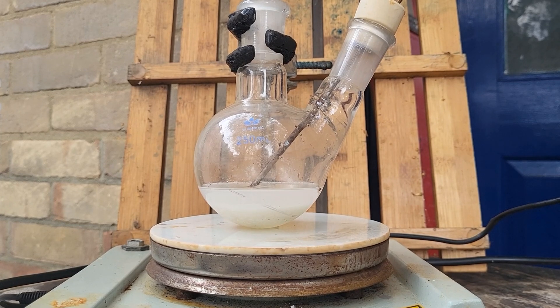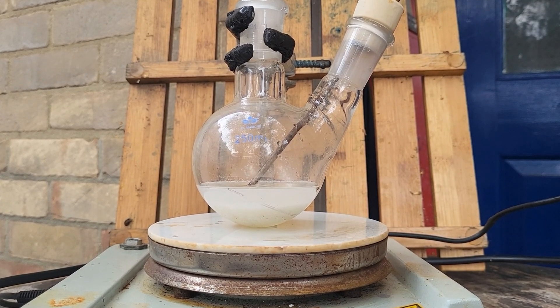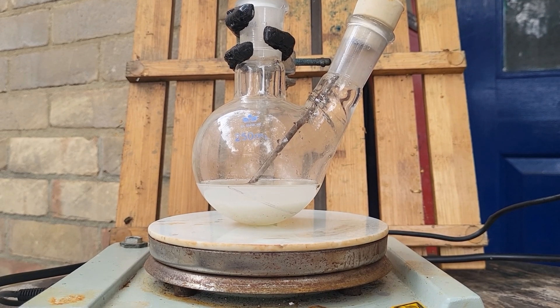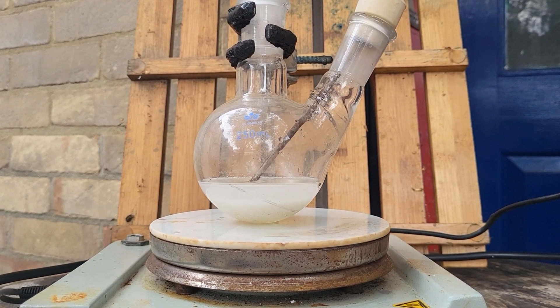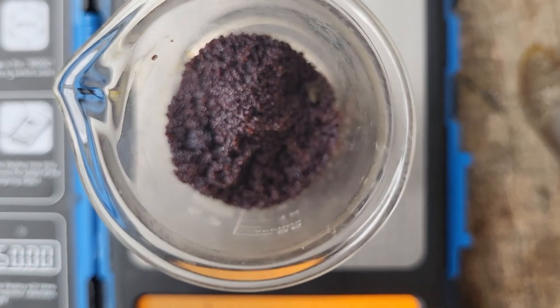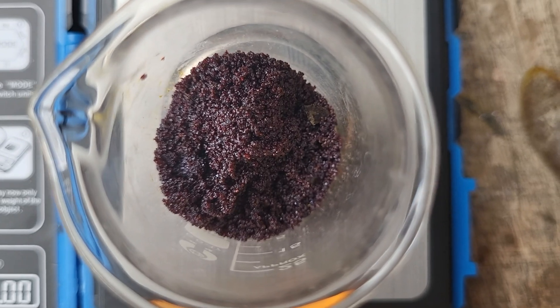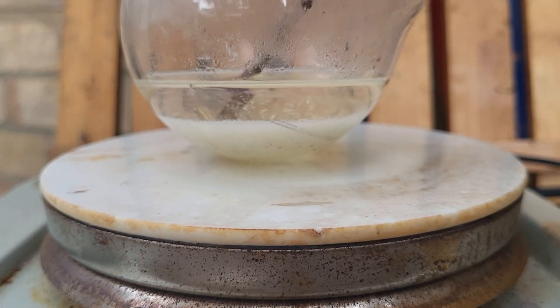In the meantime we will prepare our oxidising agent, which will be 10 grams of chromium trioxide. 10 grams. This will be dissolved in water to make chromic acid. You can see it is slowly going into solution.